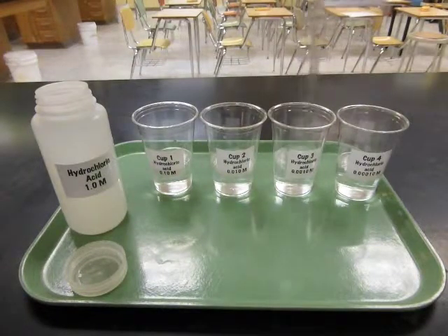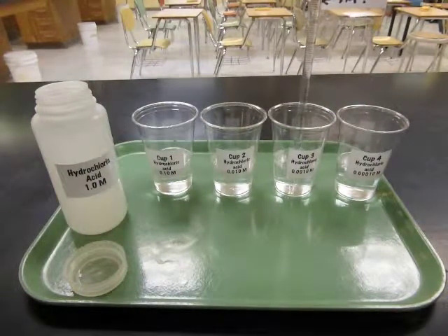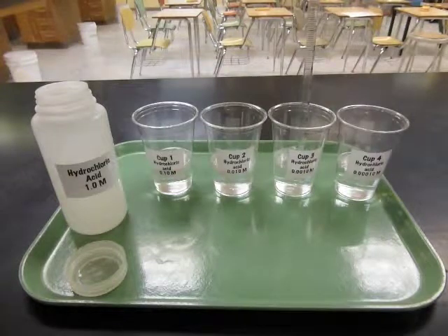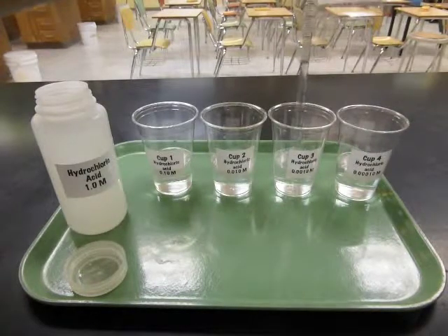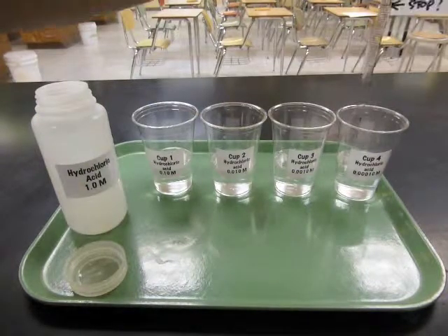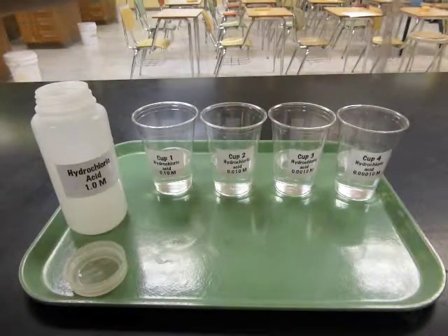And after these are all prepared, then what I'll do is put them on the pH meter to measure their hydrogen ion concentration and compare that to what we would expect it to be if the acid was 100% dissociated. If it was 100% dissociated, then the hydrogen ion concentration should be the same as the acid concentration, because all of the acid molecules that are in the mixture will have dissociated to make hydrogen ions and the conjugate base. So here's the last one. And draw that in and out a few times, make sure it's really well mixed. Okay, and swirl to mix.